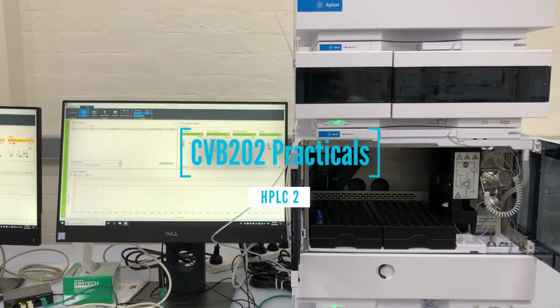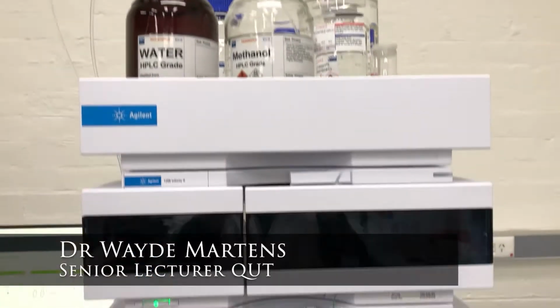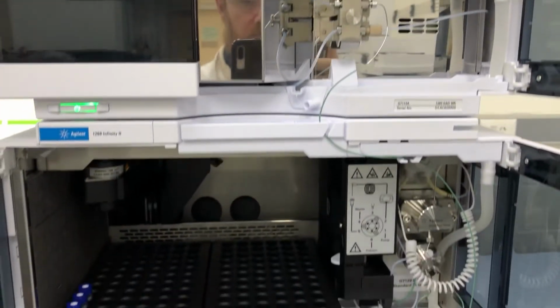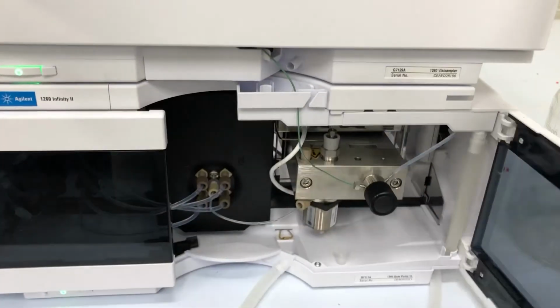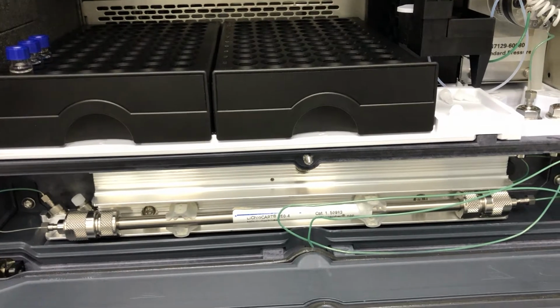Welcome to the second installment of HPLC practicals. In the first practical, we used simulation software to understand how elution parameters affected separation. Parameters such as solvent composition, flow rate, and type have a significant effect on peak retention time and resolution. In today's prac, we'll look at the instrumentation in the lab and use it to collect real data.